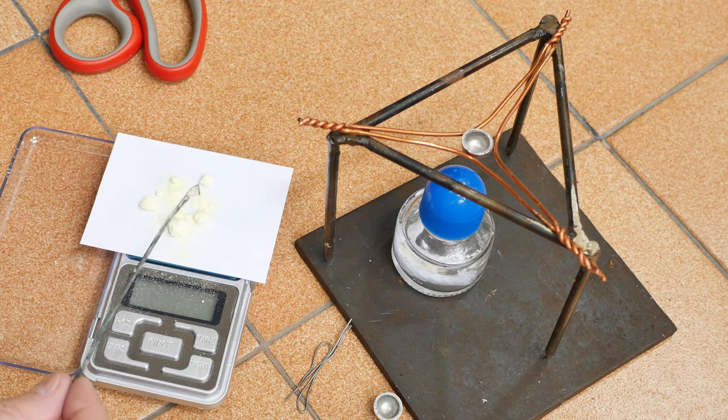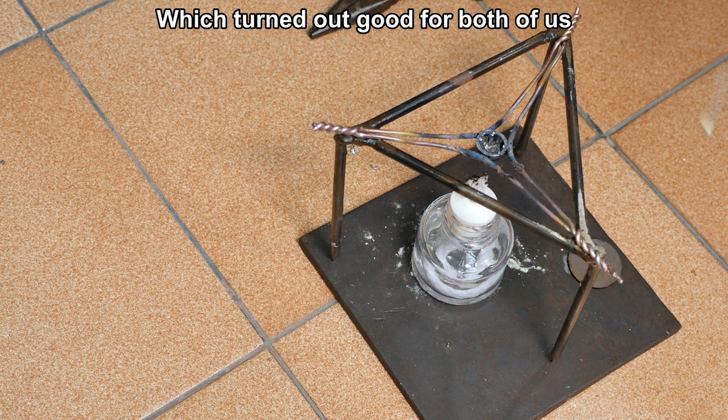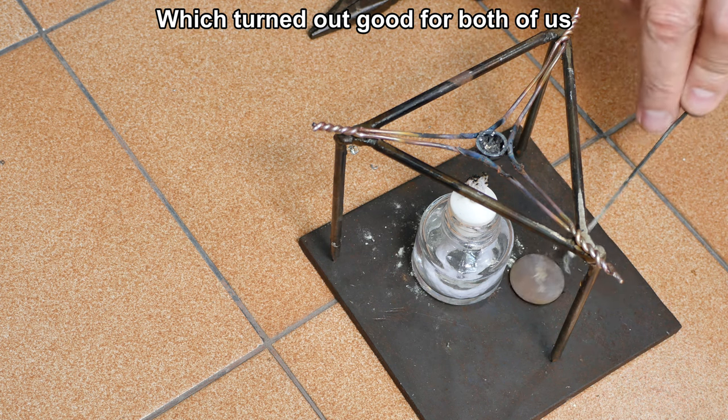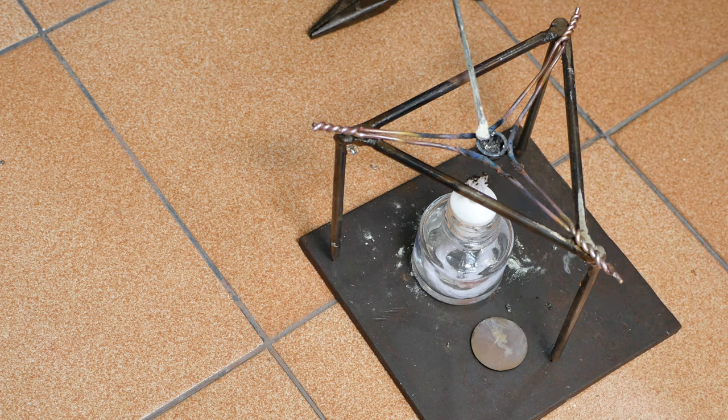So, okay, well, I just need to do that. And of course, I lost the video of actually cooking it. But what I had was this lid. This is a piece of stainless steel, and I just packed it in here up to the brim with the mixture of sulfur and lead, lit the flame and let it cook. Of course, I have a respirator and face protection, all that stuff.